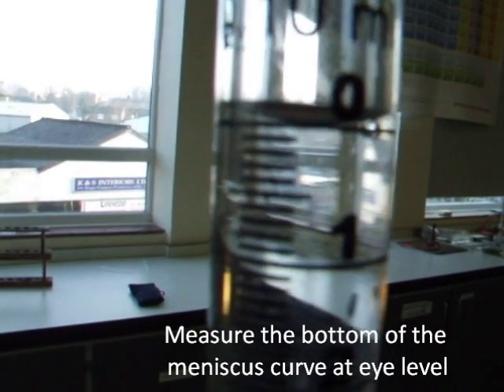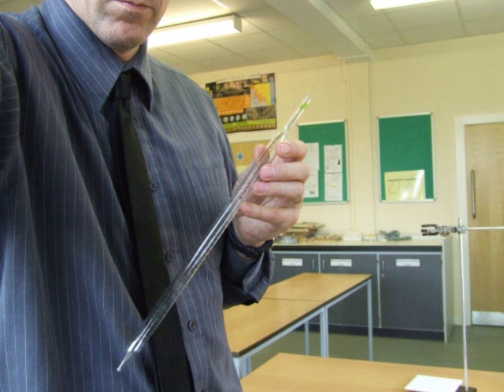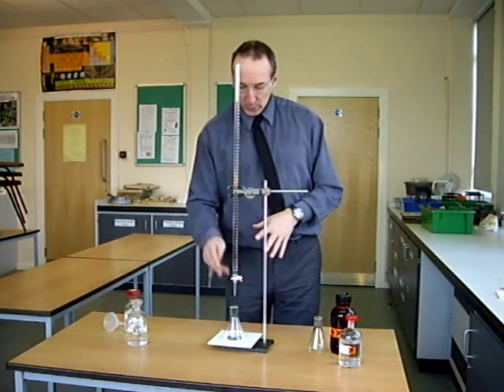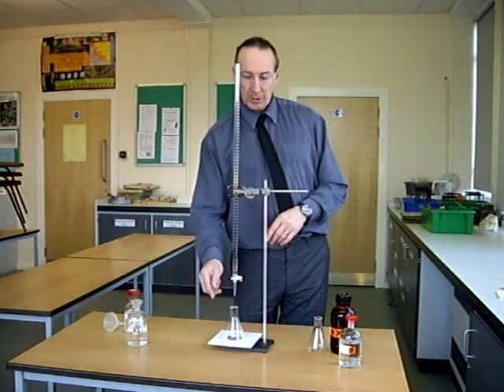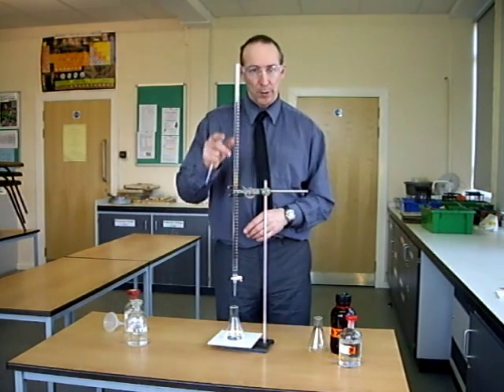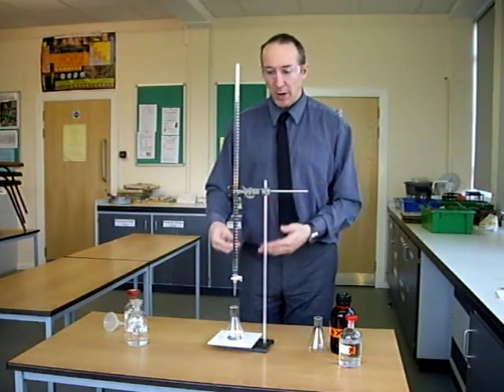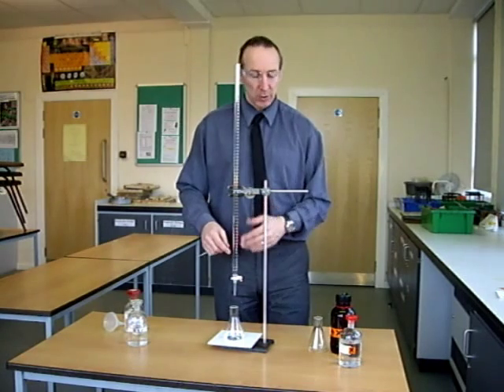Into a conical flask I will put 25 centimeters cubed of my unknown sodium hydroxide. I use a volumetric pipette to get a precise measurement. So 25 centimeters cubed of unknown concentration sodium hydroxide in here, 50 centimeters cubed in my burette of the hydrochloric acid of a known concentration. So I need to add the hydrochloric acid to the sodium hydroxide until it's neutral.